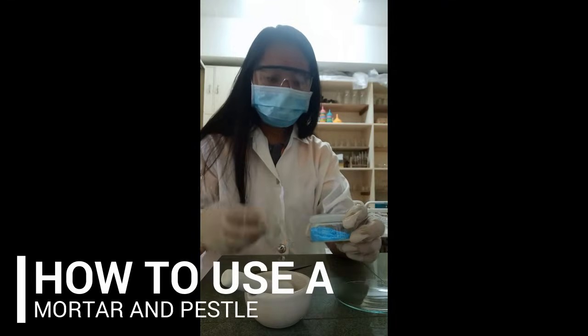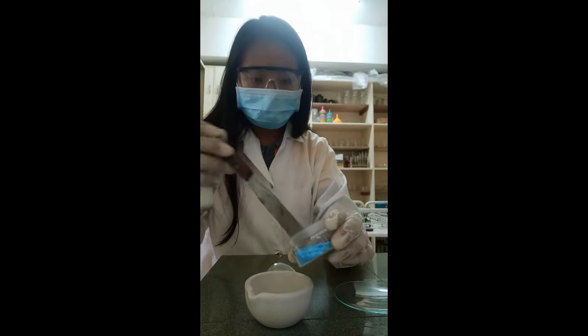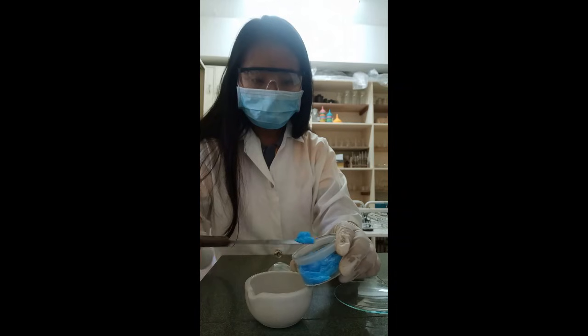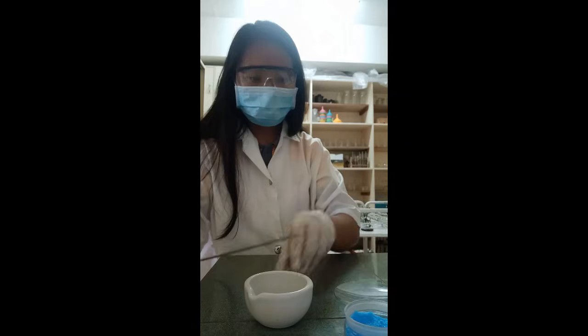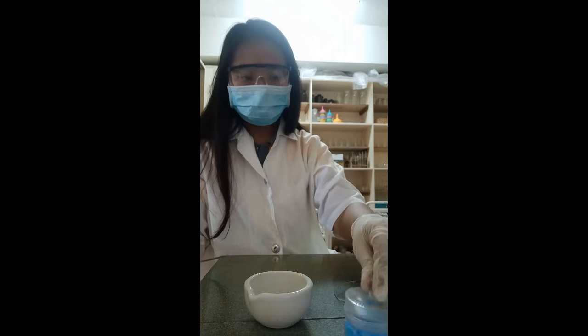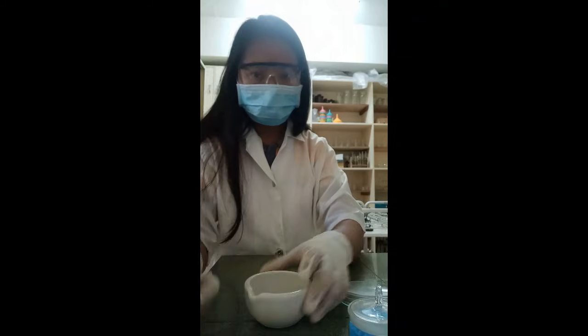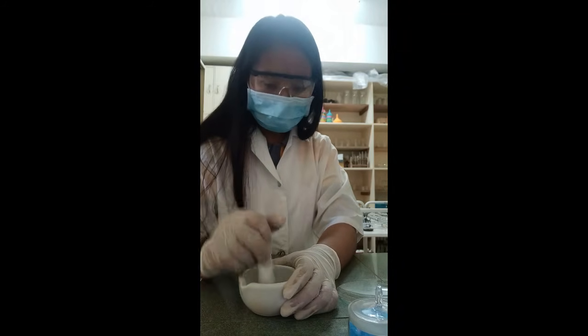How to use a mortar and pestle. Only one substance at a time for grinding or pounding in a mortar and pestle. Never use one mortar and pestle for simultaneously mixing different substances. Place the substance to be ground into the mortar, then pound with the pestle until it reaches a fine texture. Use the spatula for removing the powdered substances.